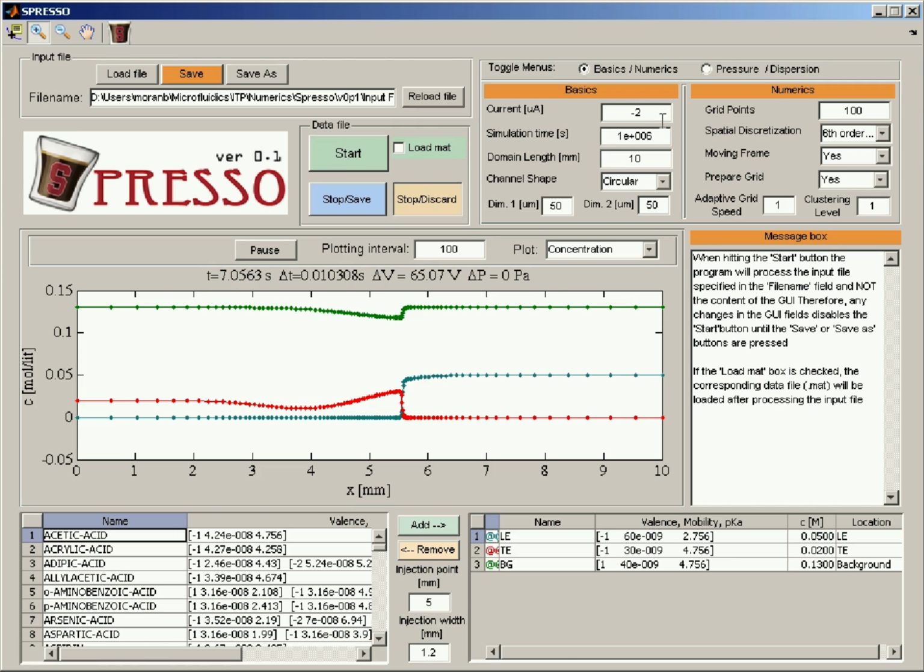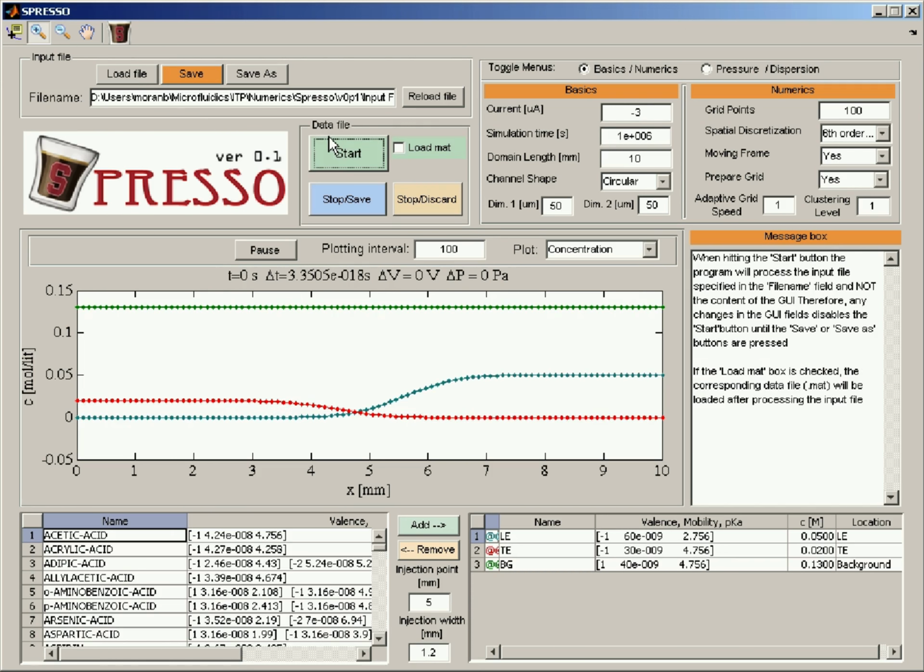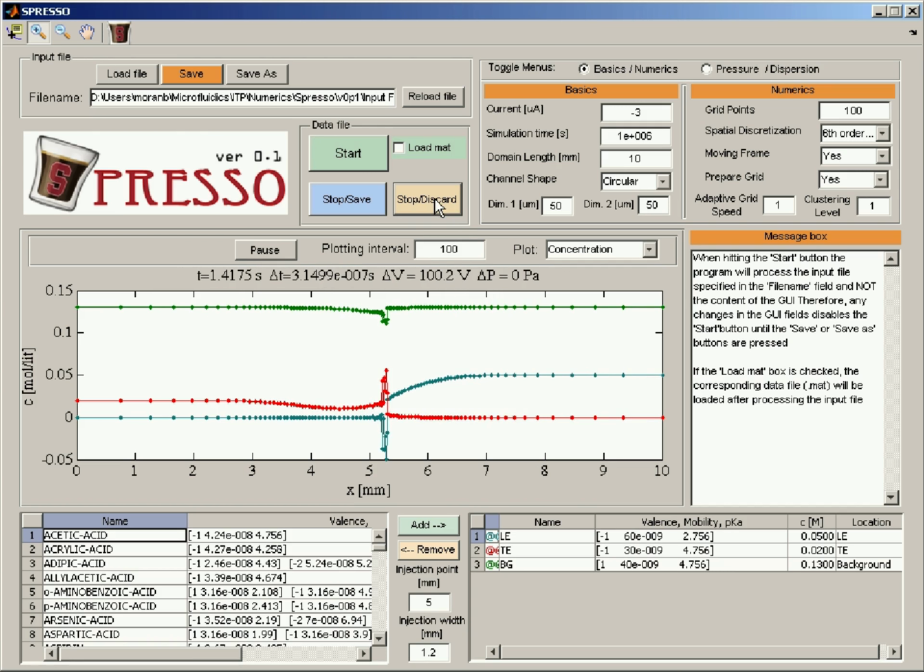Okay, so I'll stop. Let's go to 3. This should be now too sharp to be able to solve with just 100 grid points on this domain. And yeah, we get these oscillations. So let's stop and see how we can fix it.